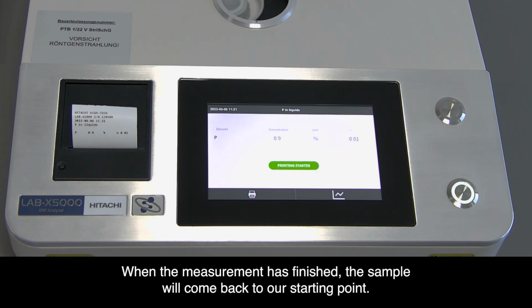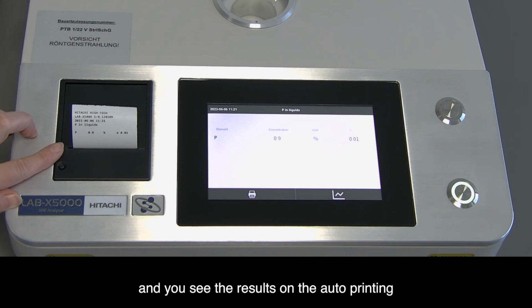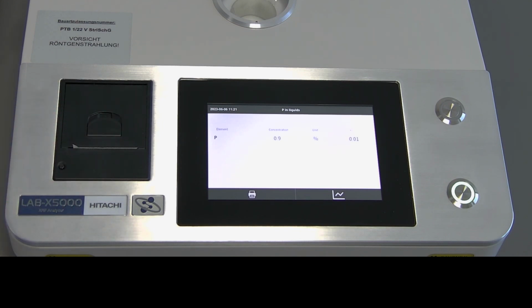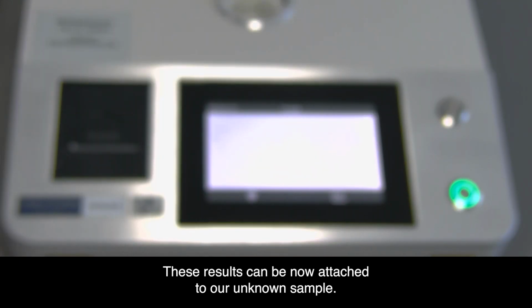When the measurement has finished, the sample will come back to our starting point. You can take it directly out of the instrument and you see the results on the auto printing. These results can be now attached to our unknown samples.